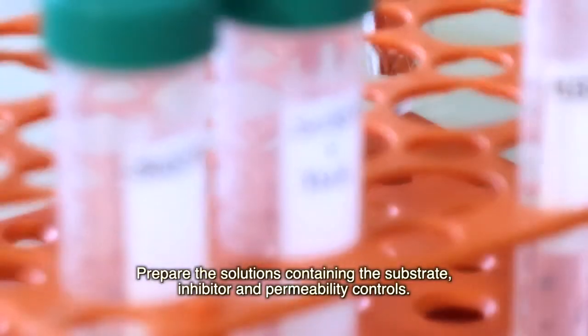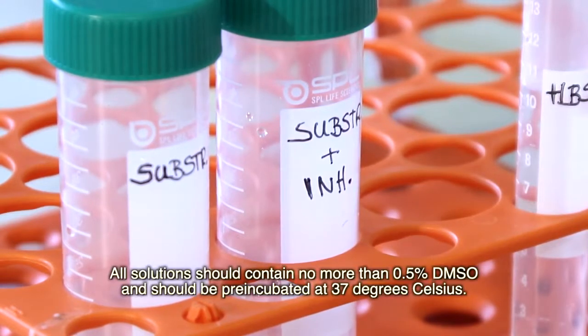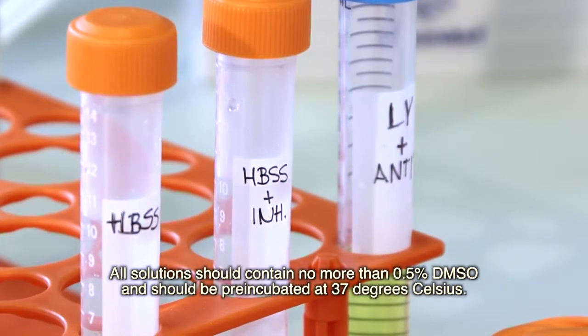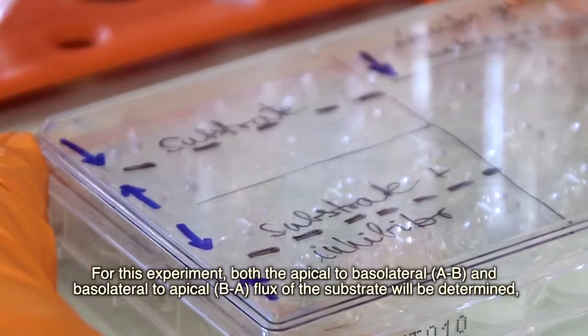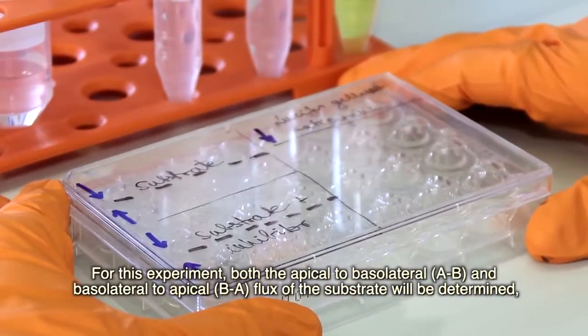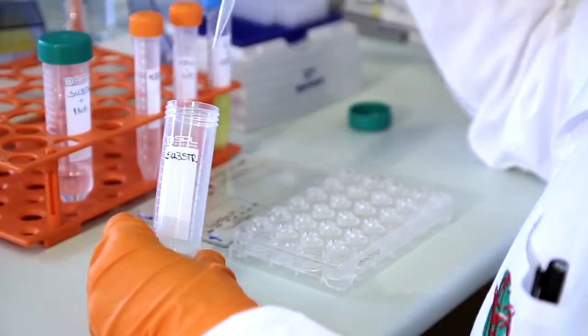Prepare the solutions containing the substrate, inhibitor and permeability controls. All solutions should contain no more than 0.5% DMSO and should be pre-incubated at 37 degrees Celsius. Label the lid of the plate according to the experimental design. For this experiment, both the apical to basolateral, A to B, and basolateral to apical, B to A, flux of the substrate will be determined, in the presence and absence of an inhibitor.